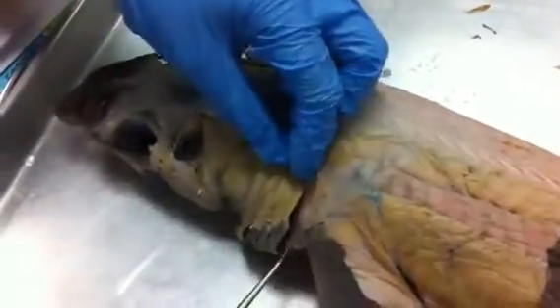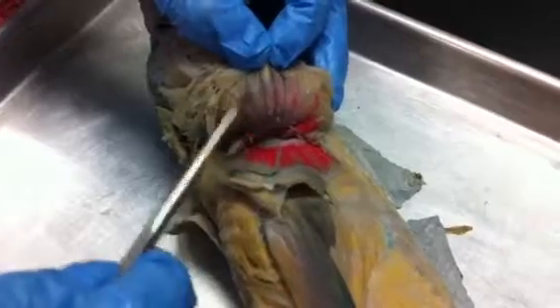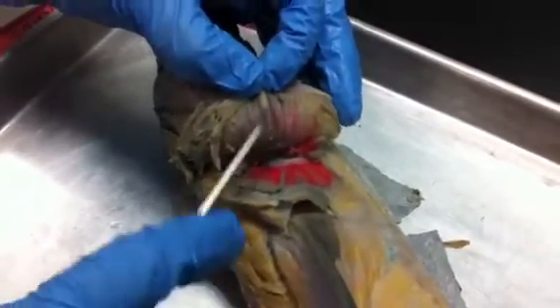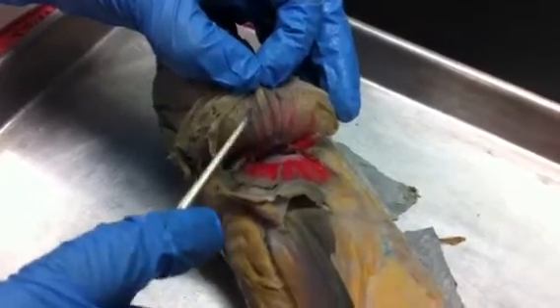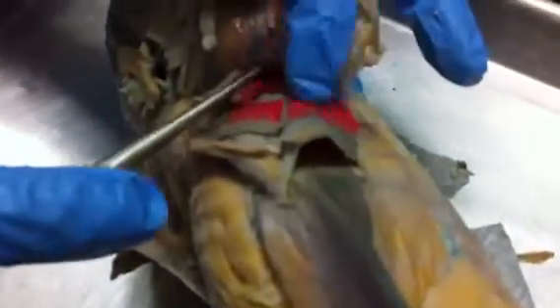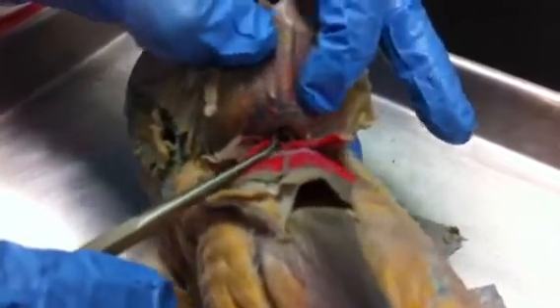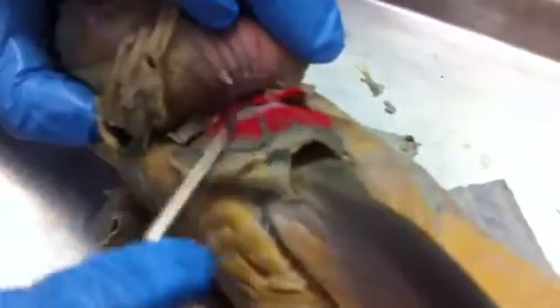Okay. And this whole thing right there, from branchial to branchial, is a branchial pouch. So we opened up the last one, and you see these seashell-like structures. Here, let me hold it up. And these little veiny purple things are called the rays, and in between them, these yellow muscles that run through are the interbranchial muscles. And the one at the very bottom, it's really hard to see here, it's the circular muscle. It kind of looks like a C. That's the adductor branchial muscle. And then we've got... What are the red things? The red things are called the lamellae.